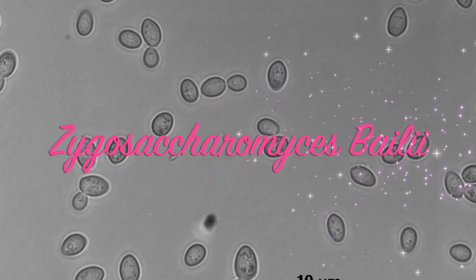My guess is that they're probably a combination of Saccharomyces cerevisiae, maybe even some Brett here. I believe that Brett can also give you some vinegar notes. However, there are some other spoilage microbes, such as Zygosaccharomyces bailii, that has indistinguishable morphology to Saccharomyces cerevisiae, along with Candida and Pichia species, making this, again, challenging to identify.